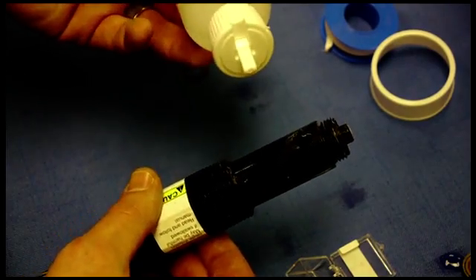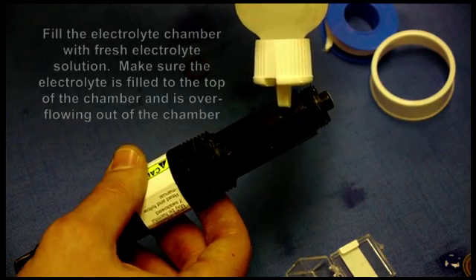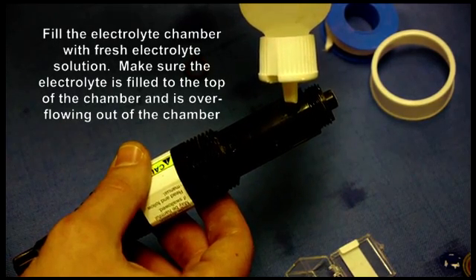So while the wood ring is absorbing the electrolyte solution, we pour the electrolyte solution into the sensor and go all the way to overflow.